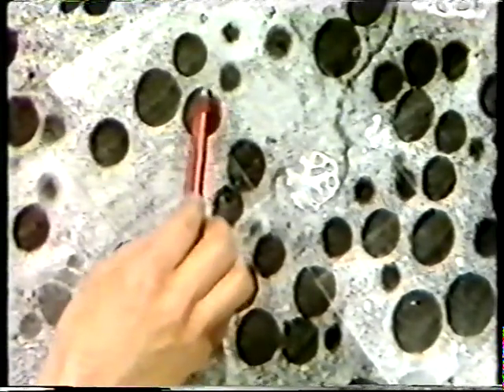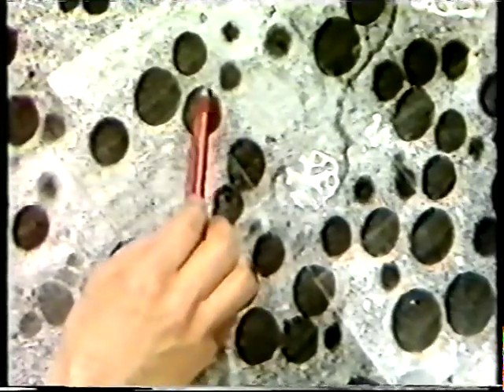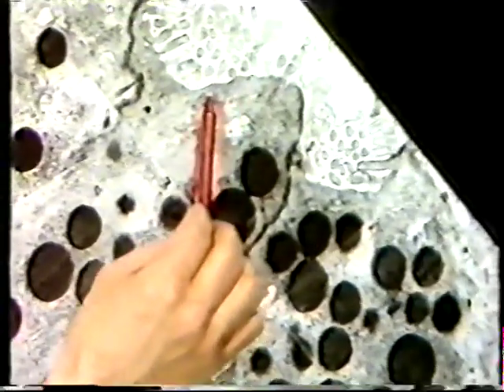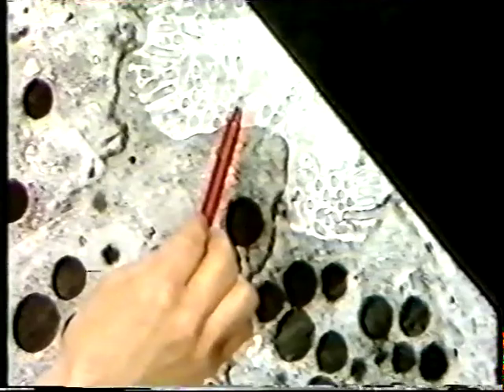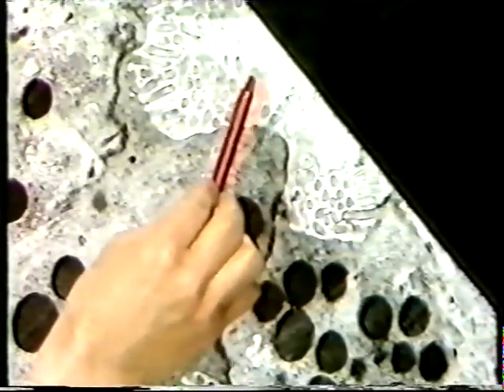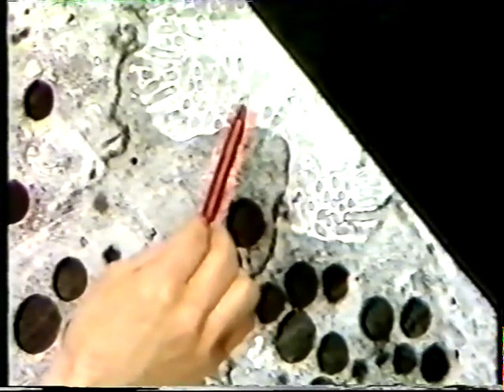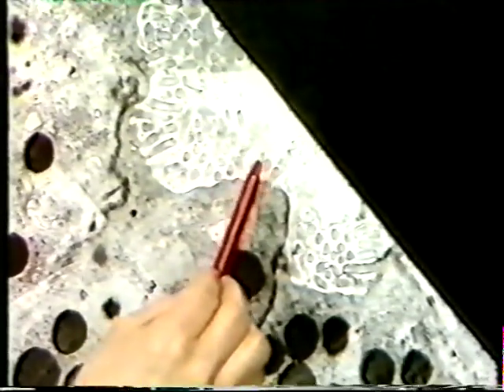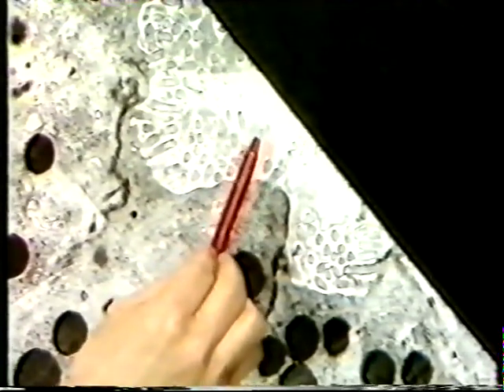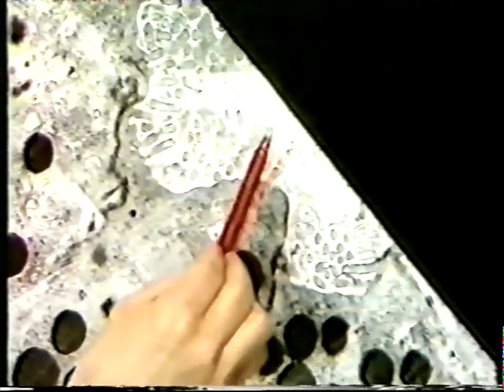These large granules are bounded by a membrane. It's difficult to see at this magnification, and as we move up towards the apical membrane of the cell, we can see that there is a lot of floccular material in what's the lumen at the top of the cell. These large dark granules in the cell are probably secreted into the lumen. So the enzymes would be secreted from the cell into the lumen and passed down to the pancreatic duct.